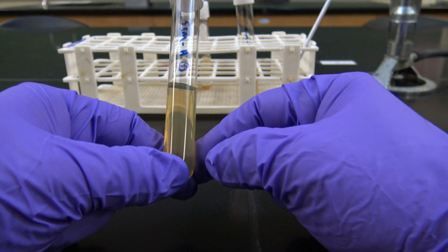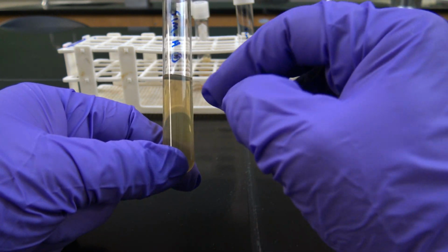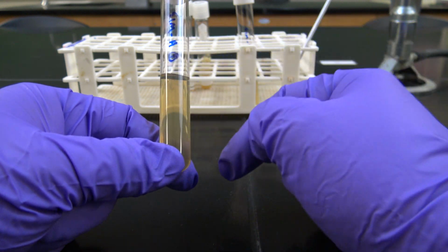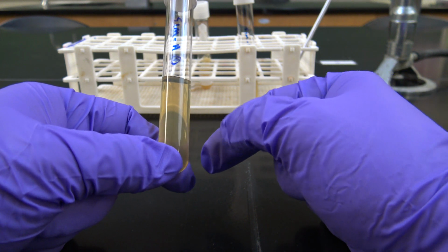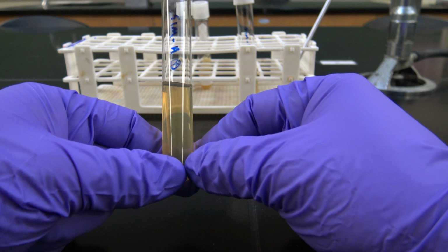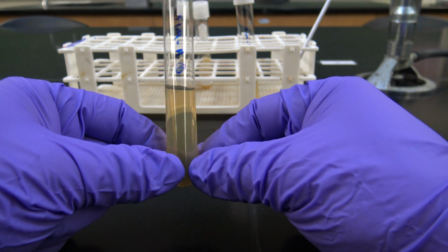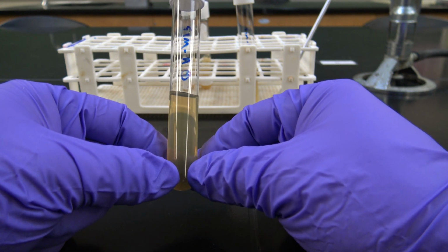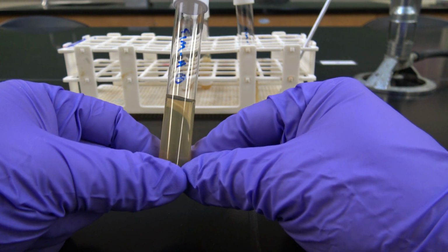Also, to check for hydrogen sulfide production, a black precipitate will form in the media to tell us if it's producing that hydrogen sulfide byproduct or not. And that's also another characteristic on your list to further identify these microbes. So I'm just going to show you how to properly inoculate these, and then we'll look at the results in 24 hours.